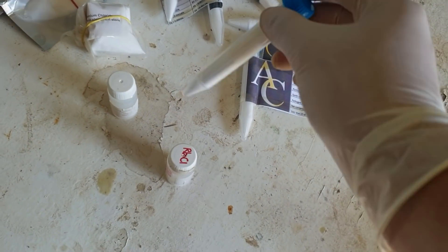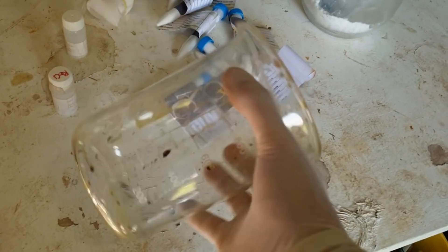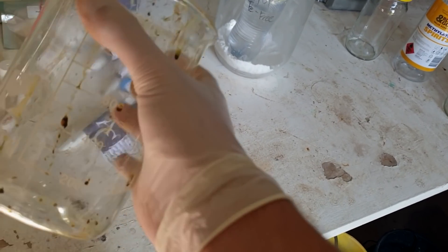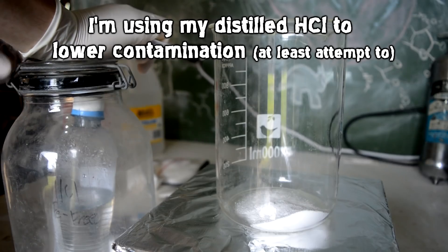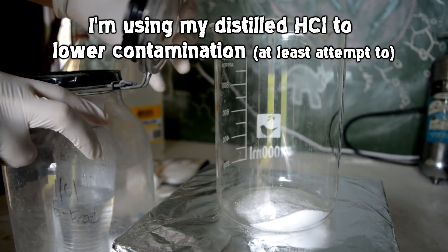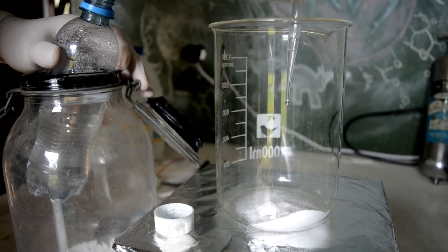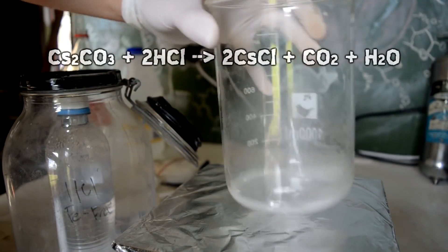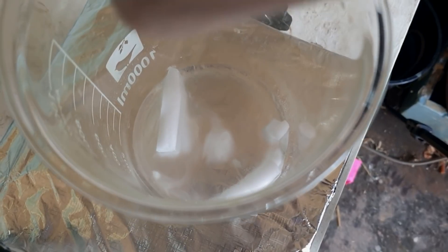We'll just turn one of these into chloride, that's 20 grams of carbonate. Maybe two, we'll go with two, why not. Now I don't want to overflow things and have it spill everywhere, so I need the biggest beaker I have, which is this one which is filthy. Next task of the day is to get this to a somewhat respectable state.